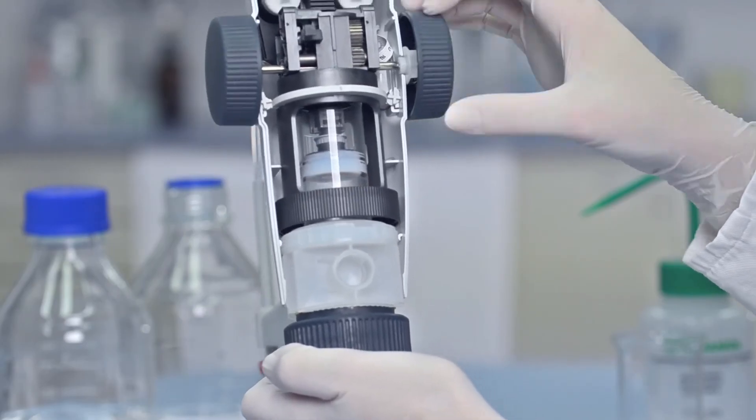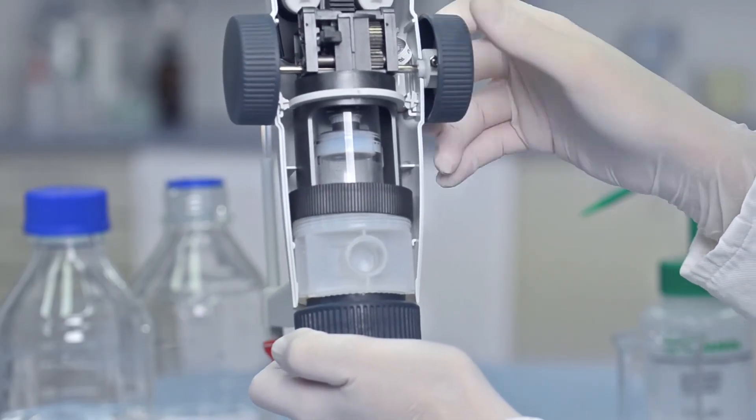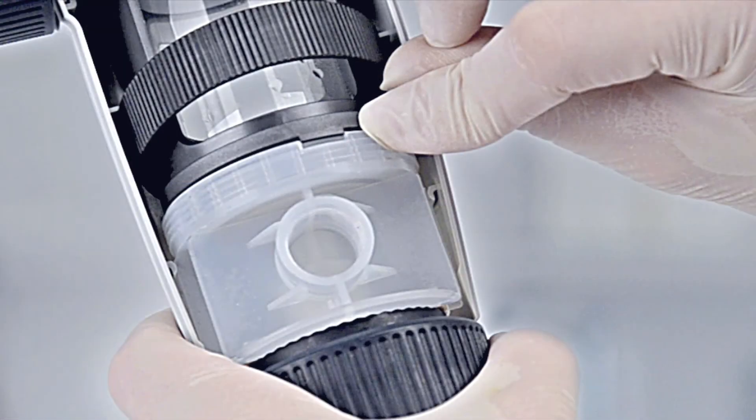Attach the top part of the instrument and turn it downward. Lift the safety ring and check that the nut and bolt mesh securely.